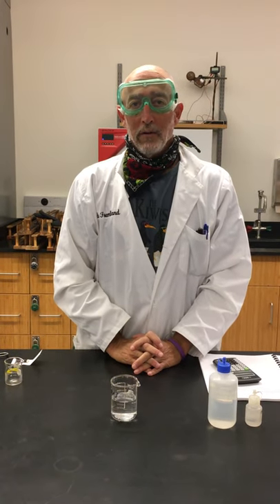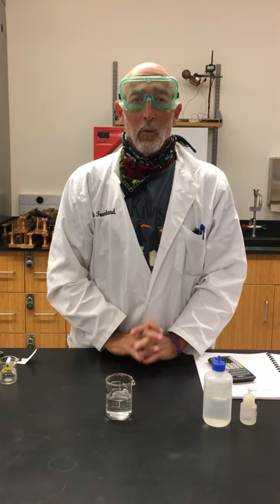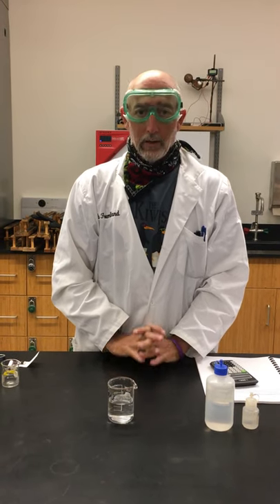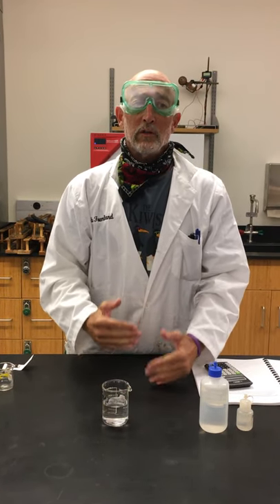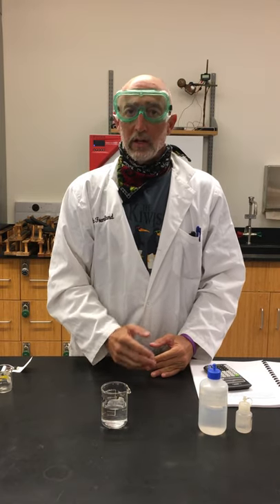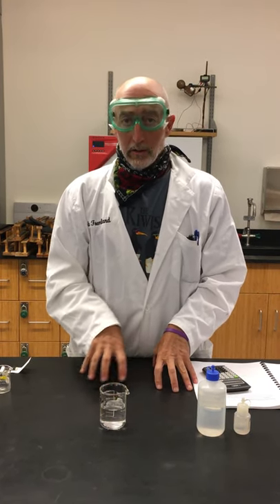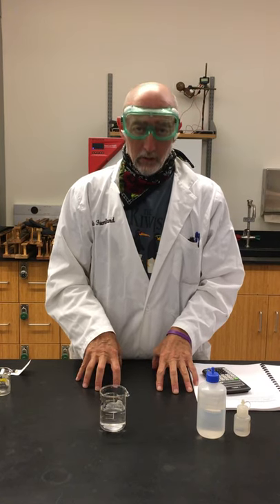This is experiment five, activity three: more on properties of dry ice and carbon dioxide. As you look at these videos, watch the whiteboard discussion, because in the whiteboard discussion I'm going to go over balanced chemical equations and things of that nature.